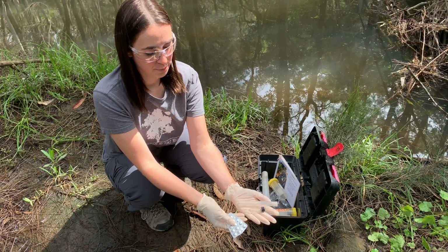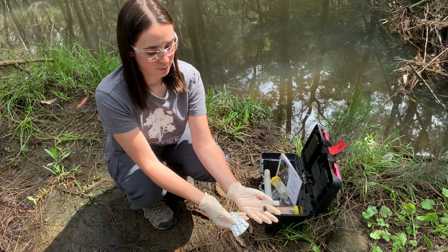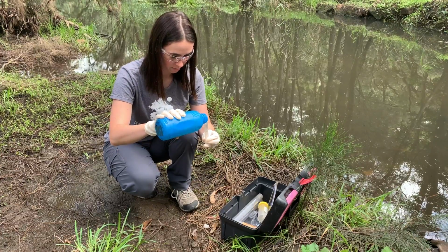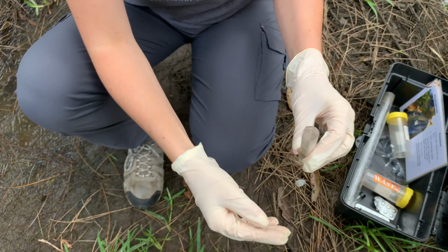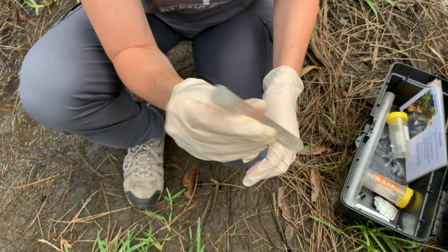The second test we will conduct is for phosphates, which are chemical pollutants that come from different products we use, such as detergents when we wash our cars, or fertilisers that we use on our gardens. After filling a test tube with a small amount of water, we will put in a special tablet designed to test phosphates into the water and give it a good shake until it dissolves.